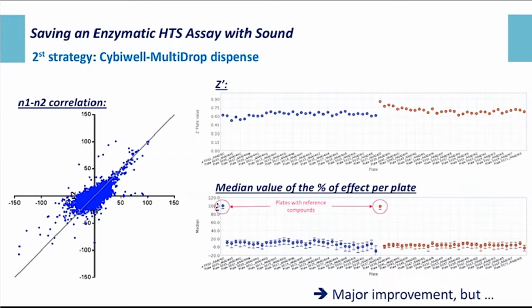As you can see, there is a major improvement in the correlation and Z prime by plate, even if we can see some small variation in the Z prime. At the bottom part, you've got a graph that represents the median effect of the compounds by plate. As the compounds have a random distribution in the plates, we should observe a similar median value of the compound effect by plate. And as you can see, there is no big difference between plates and between N. So definitely, we can see a major improvement of the automation of the assay. But it's improved, it's not perfect, as we can see in the next slide.